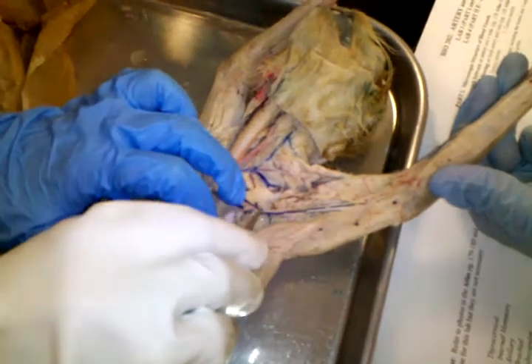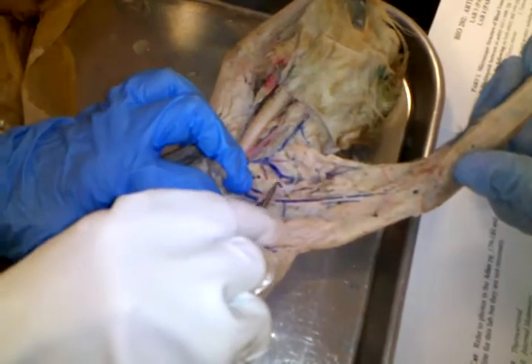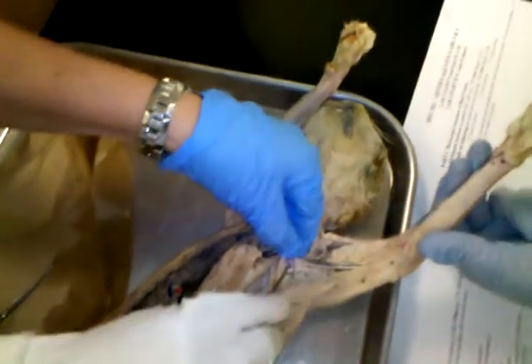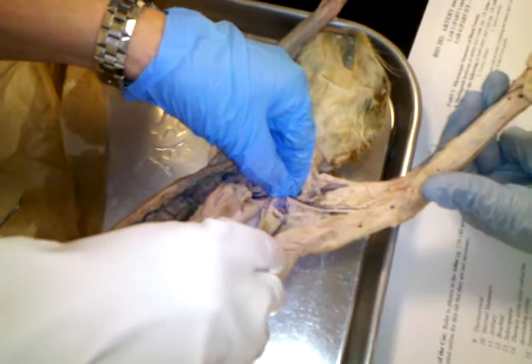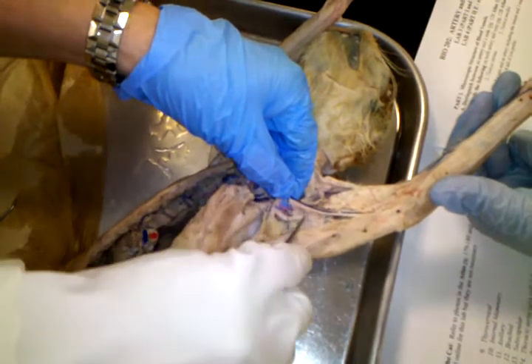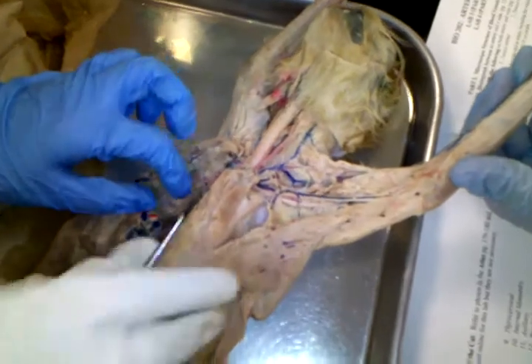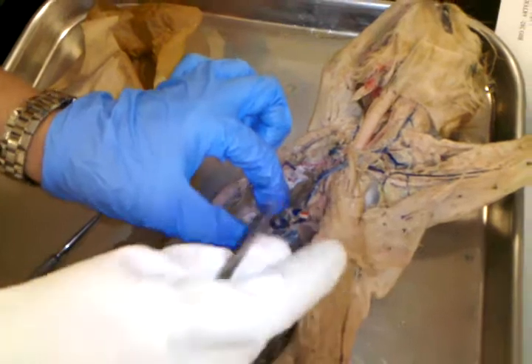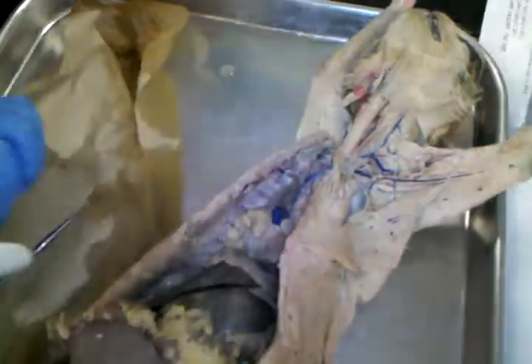Okay, now that branch that I wanted to show you that you have to know, see how there's this vein right here? That was a subclavian vein. It looks like it's gotten broken off. But there should be, see this main artery that comes off and goes down, looks like it's going up under the scapula? That's the subscapular artery, and that's the breaking point where it changes from axillary to brachial going into the arm. Okay, now if you will review these, I will come back and go over the veins with you in a minute. And like I said, you're just going to have to kind of hold the heart in place. Okay?